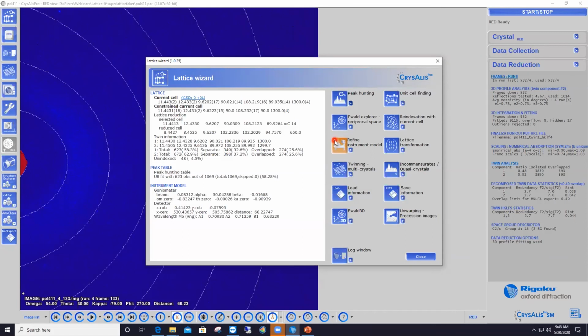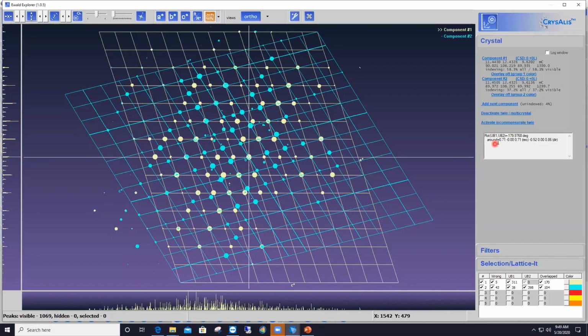But if you go again to the Ewald Explorer, you see that the same way that I had a twin multi-crystal feature, just underneath Lattice-It, there's an activate incommensurate structure feature as well. So this is the feature that you use, and an additional dialog will open up for you to enter the value of the Q vectors that you think are best. And once you enter those Q values, you can refine the cell including the Q vectors. And then this is basically all you need to do in the reciprocal space viewer, and everything is done in there.